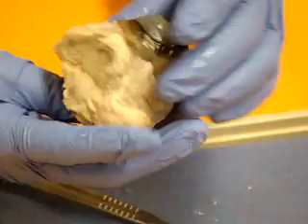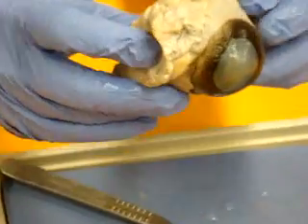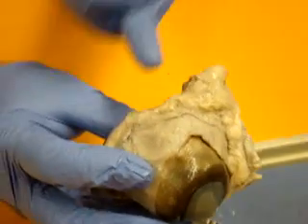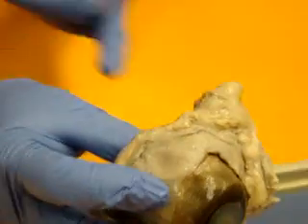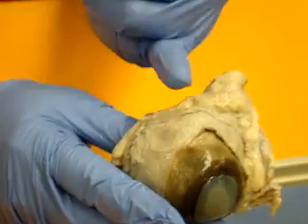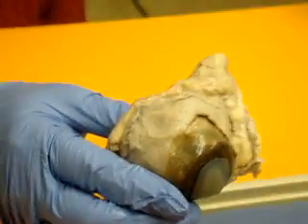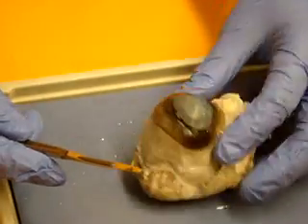This is probably a right eye, which would make these here your rectus, rectus, rectus, oblique, oblique muscles. But I won't ask you that on the sheep's eye.